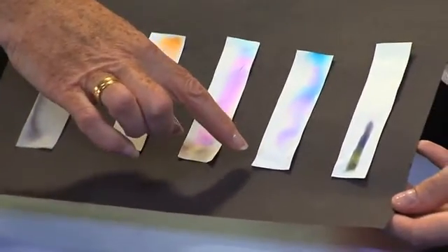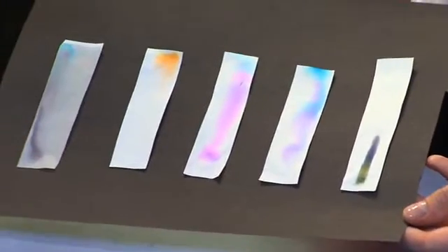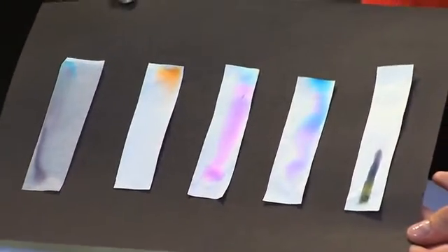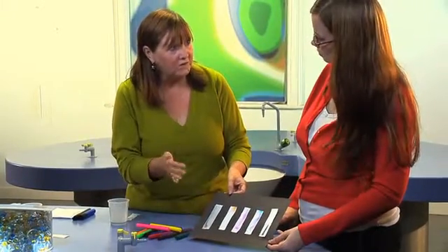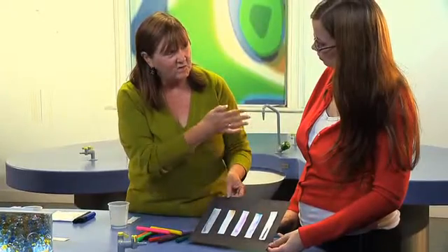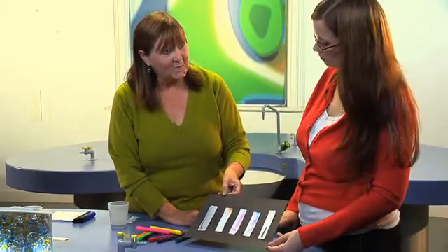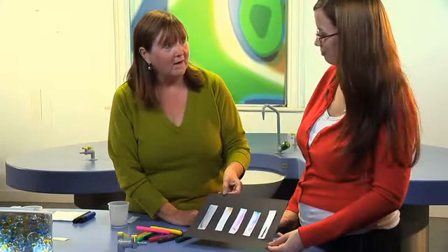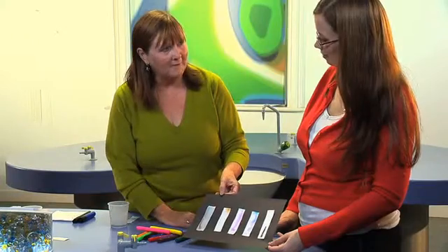And this one is purple. That's a handwriting pen, a black handwriting pen, which has worked. It's OK. It's not wonderful. And certainly, permanent marker doesn't work because water, which we're using as a sort of solvent, doesn't work with permanent marker. And to be honest, those dry wipe pens that we use in school all the time, they aren't very good either. The thing to do is experiment and let the children experiment to see if they can predict what happens splitting up inks.